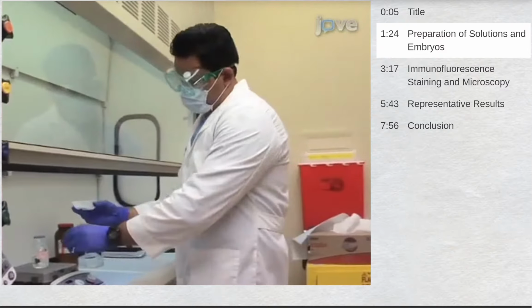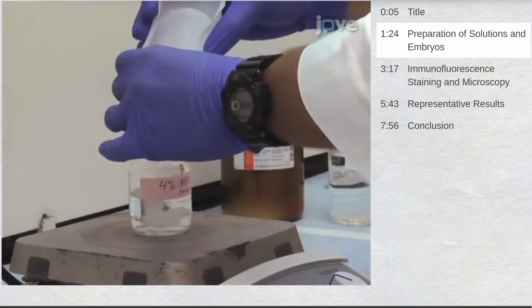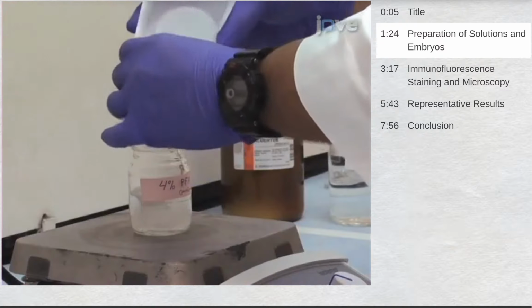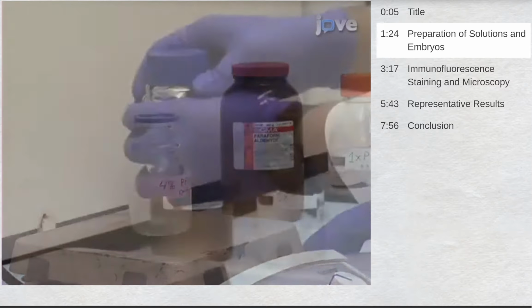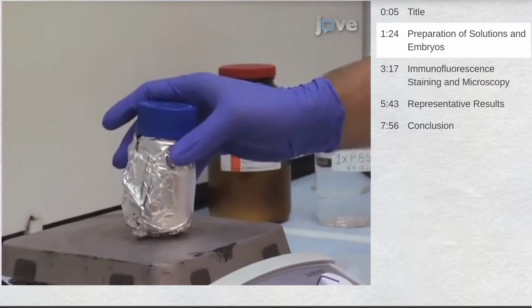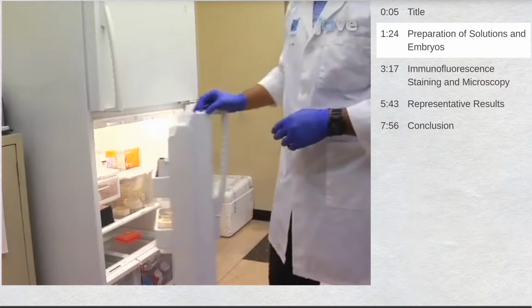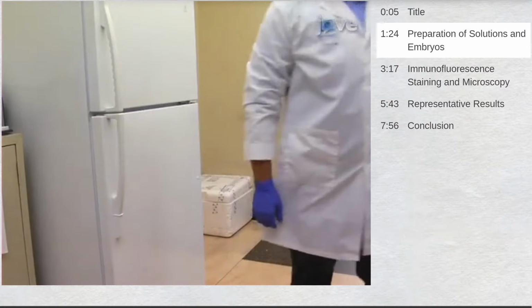Under a chemical fume hood, prepare 50 milliliters of 4% paraformaldehyde, or PFA, by adding PFA powder to 1x PBS. Shield from light and stir at 60 degrees Celsius for 1 hour to dissolve. Store at 4 degrees Celsius for 1 month or at -20 degrees Celsius for 2 years.